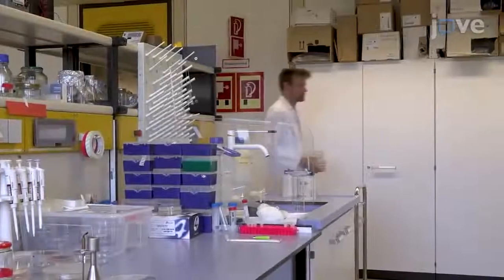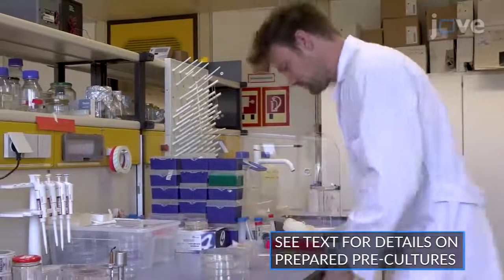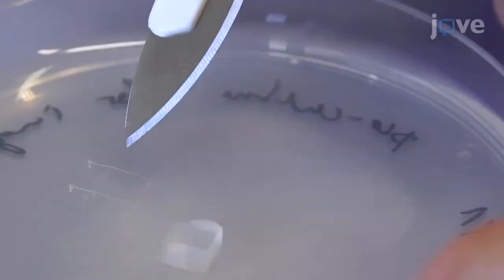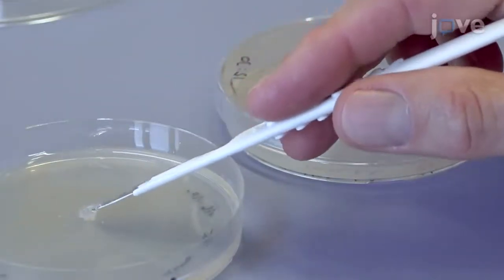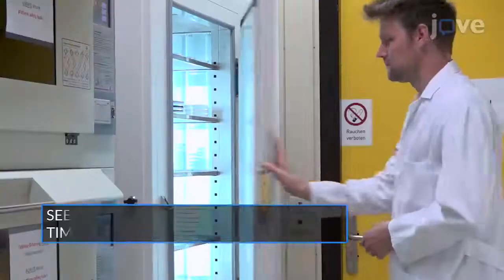To begin this procedure, first obtain a prepared preculture. Use a sterile scalpel to cut a small agar block that carries non-sporulating mycelium from the colony edge of the preculture. Place the agar block at the center of a fresh solid medium plate to inoculate the experimental culture. Incubate the experimental culture according to the developmental stage intended to be investigated.